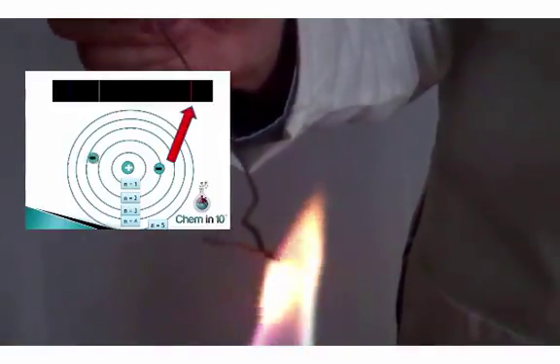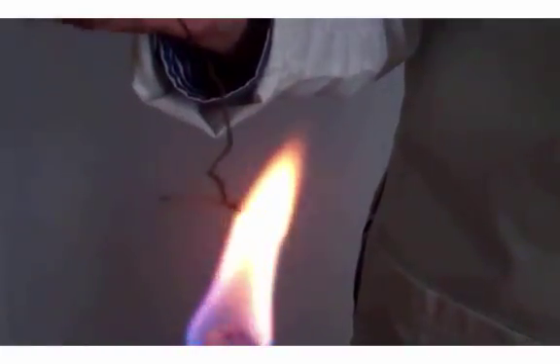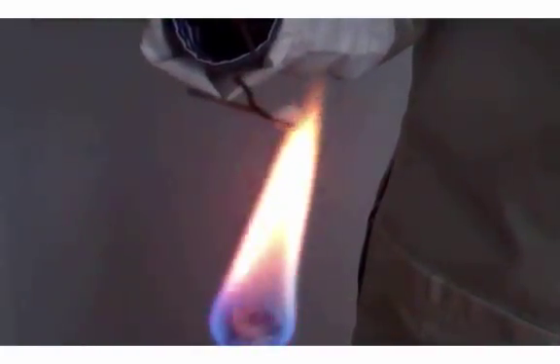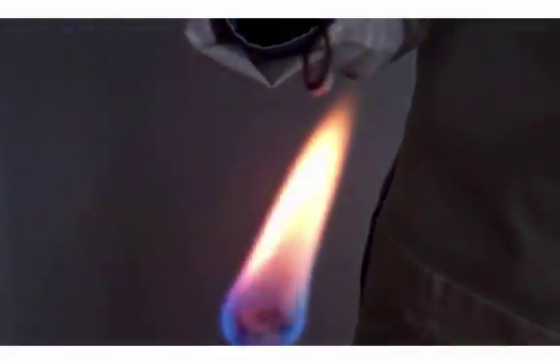So for our table salt, that's pretty easy to get. And that burns a characteristic orange flame.